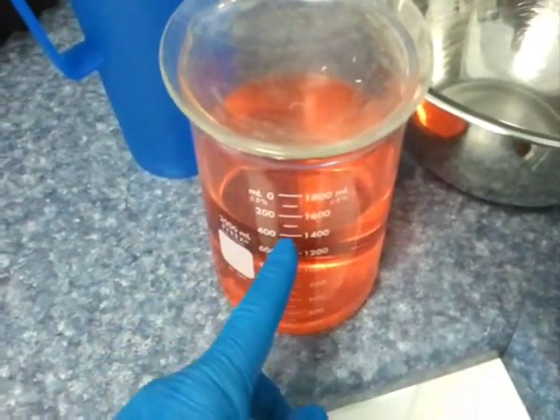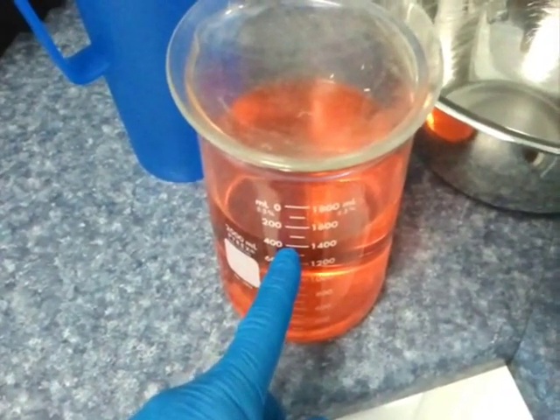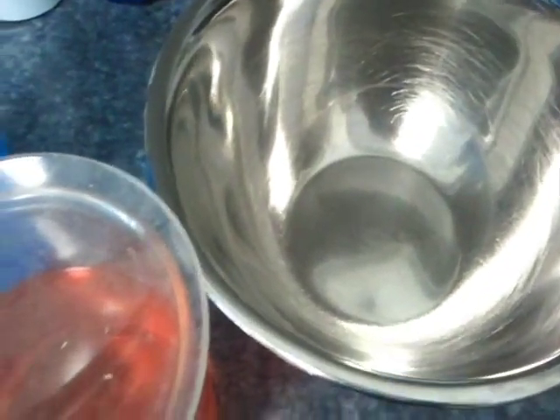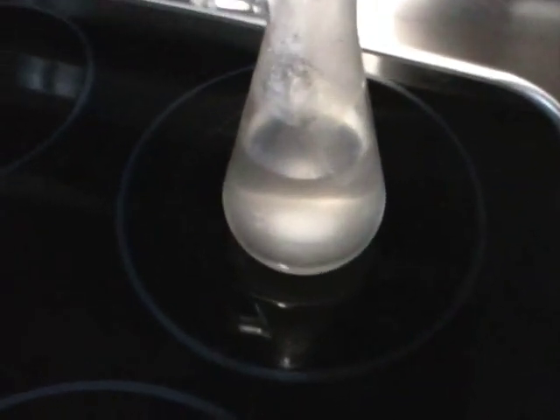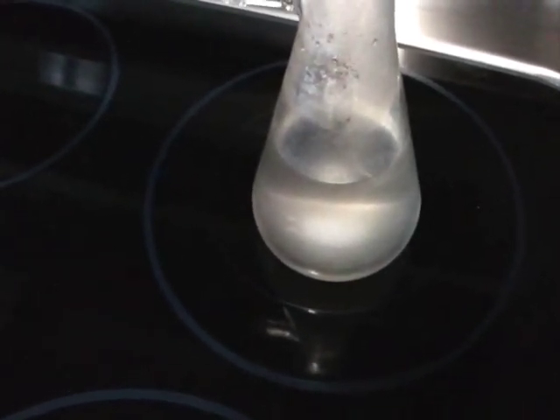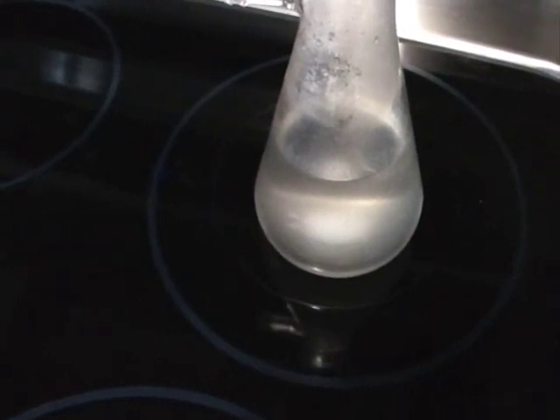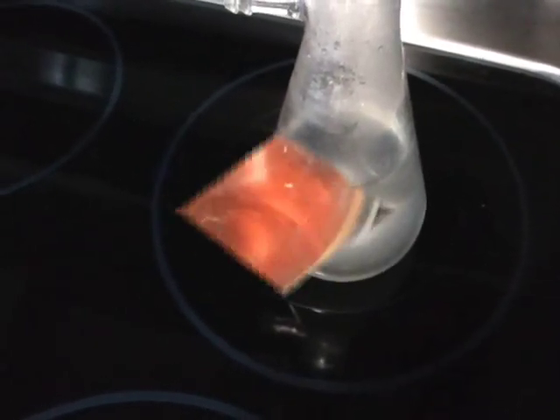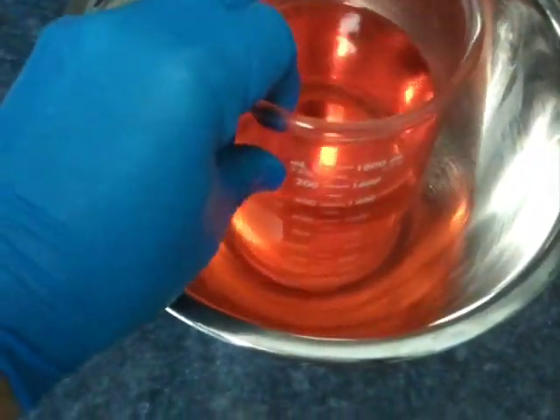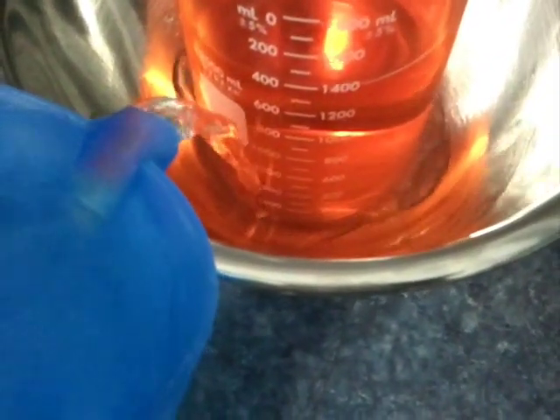This is a solution of approximately 40 grams of platinum in 1,400 milliliters of liquid. I have a stainless steel bowl here, a pitcher of water, and over here I have a beaker that I have begun to dissolve the required 60 grams of potassium chloride in 175 milliliters of distilled water for the precipitation portion of the reaction. I am going to place the platinum solution into the stainless steel bowl and add the tap water around the edge of the beaker.